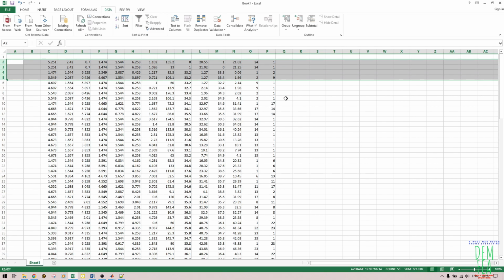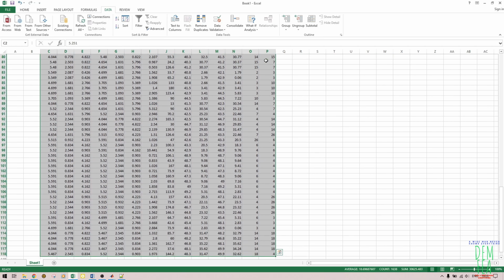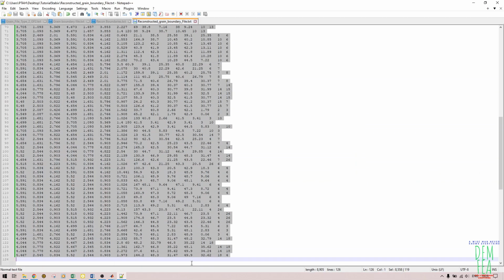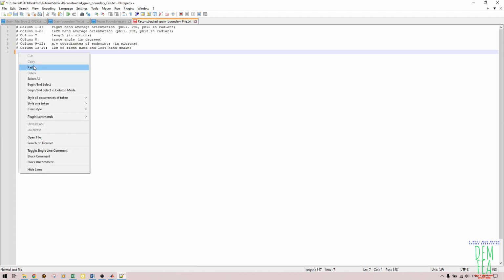So I'm fixed, I'm set. So there are no zeros. All the values with zeros are gone. So like that, and then I do this, Control C, like that. And then I come here to my reconstructed grain boundary file. You can easily do this. Delete everything and then come here and paste.